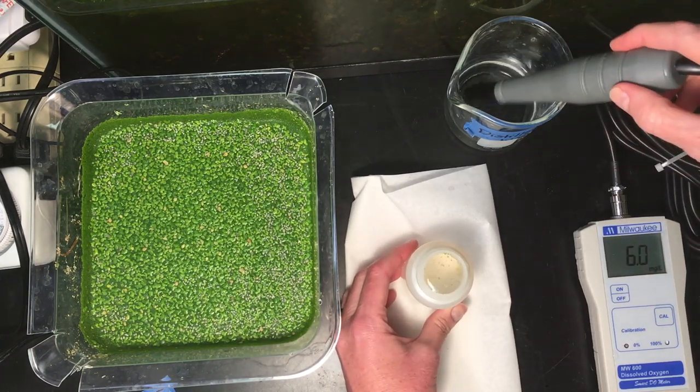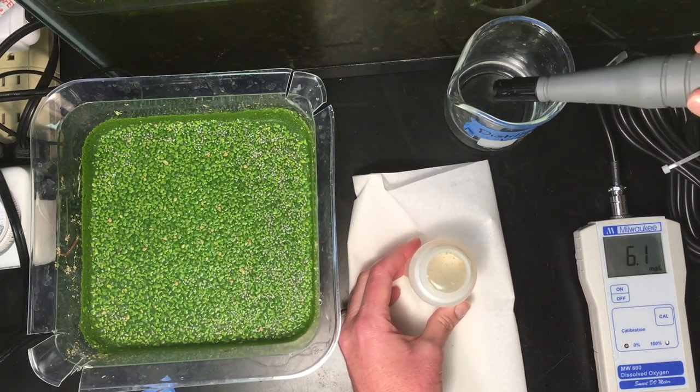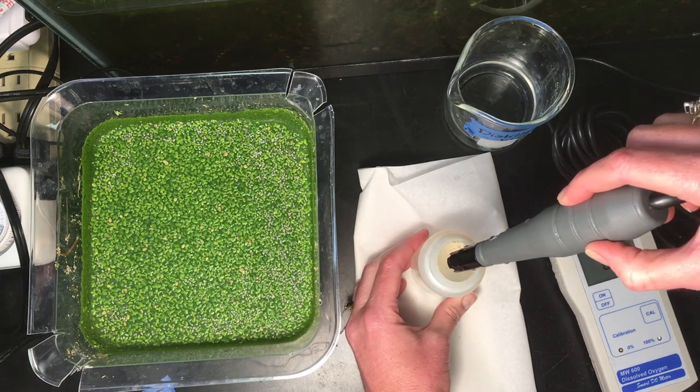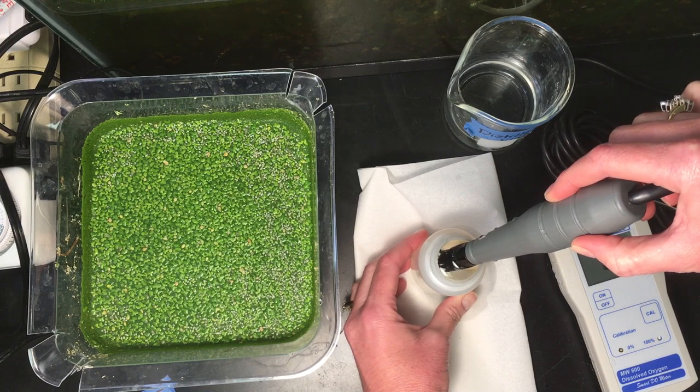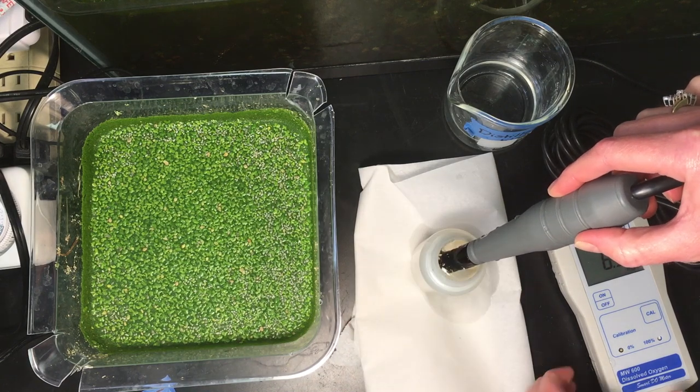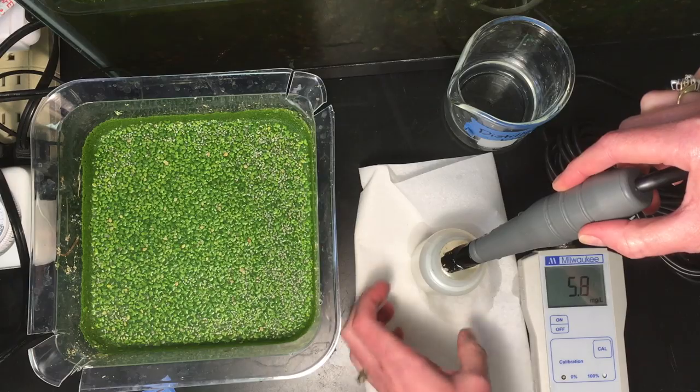And so now I'm going to take my dissolved oxygen probe and put it in my sample and wait about a minute for the number to stabilize.